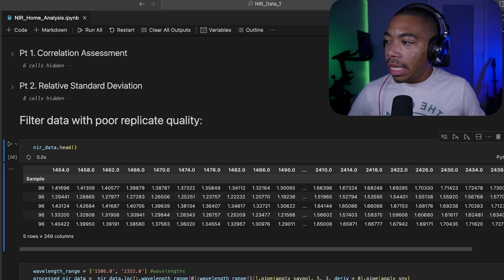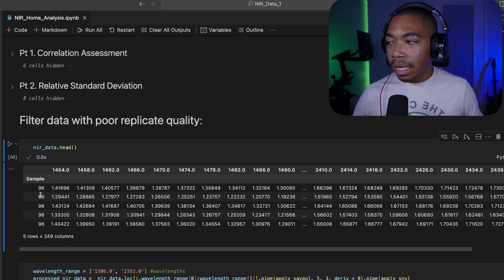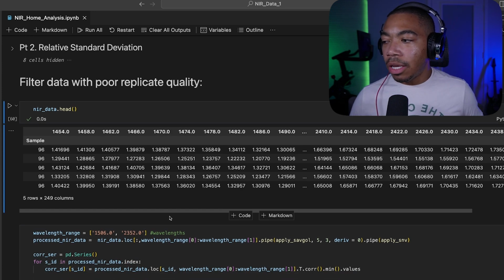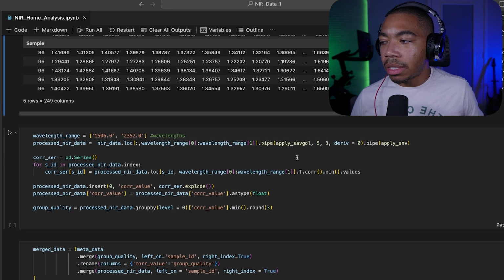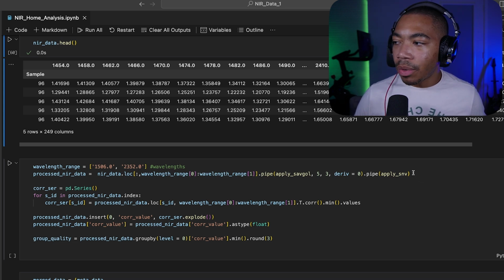What we have here is our NIR data, where each sample represents a replicate. In this case, we're looking at sample 96 with at least 5 replicates shown here. And along the columns are our wavelengths. In the next cell, we begin to dig deeper into understanding the quality of the data, the quality of our replicates. I'm going to select a smaller wavelength range, and we're going to process the data within this range using 2 different signal processors. The first one is the Savitzky-Golay with a window length of 5 and a polynomial order of 3. And then we're also going to apply the standard normal variate to also help adjust for some of the scattering within the data.